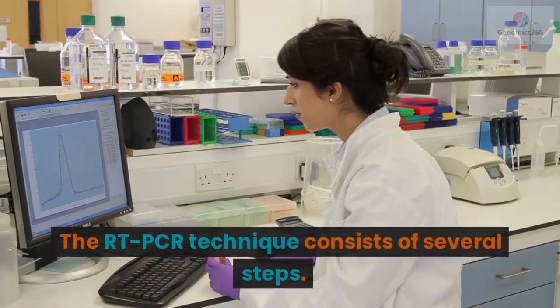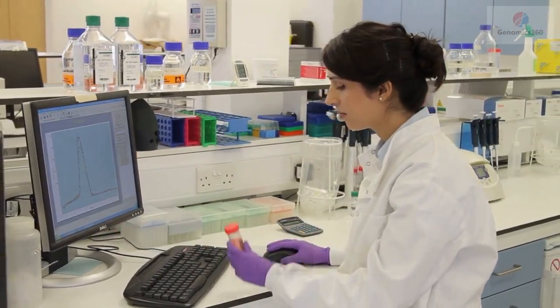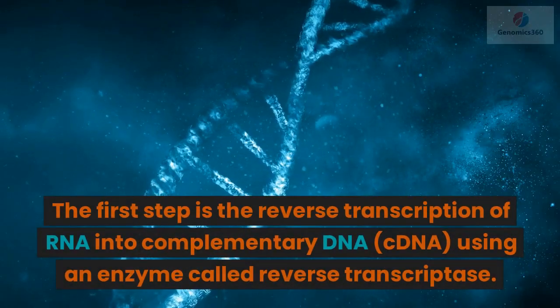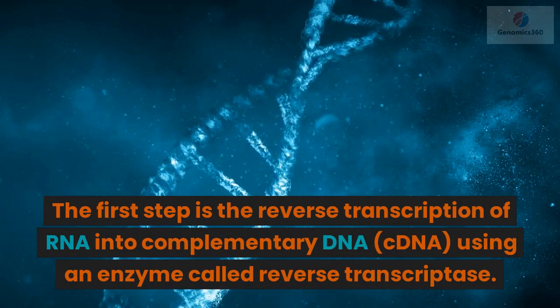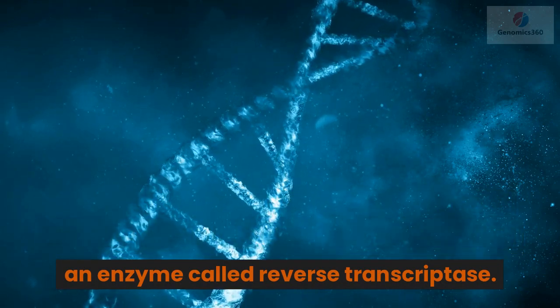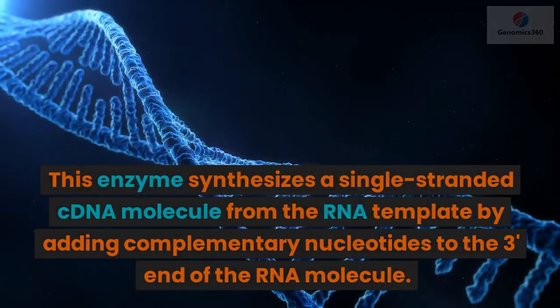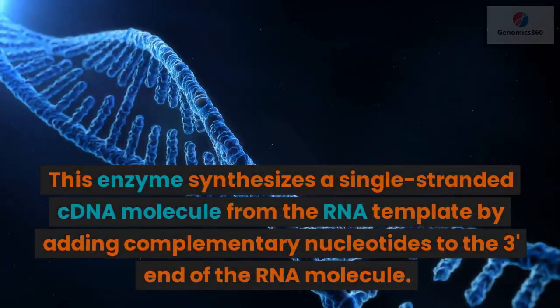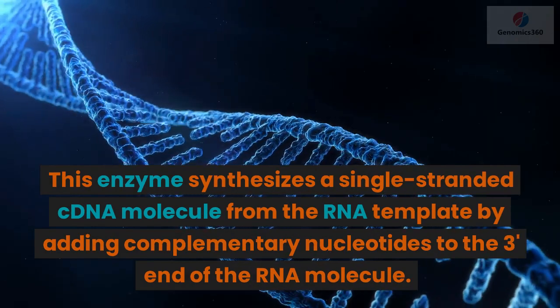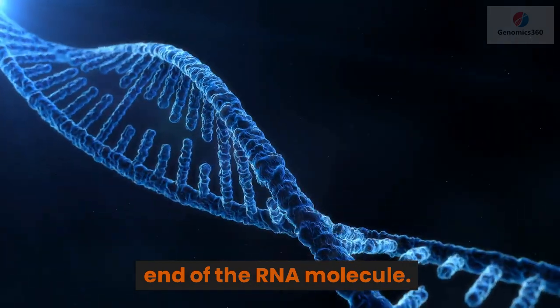The RT-PCR technique consists of several steps. The first step is the reverse transcription of RNA into complementary DNA, cDNA, using an enzyme called reverse transcriptase. This enzyme synthesizes a single-stranded cDNA molecule from the RNA template by adding complementary nucleotides to the three-prime end of the RNA molecule.